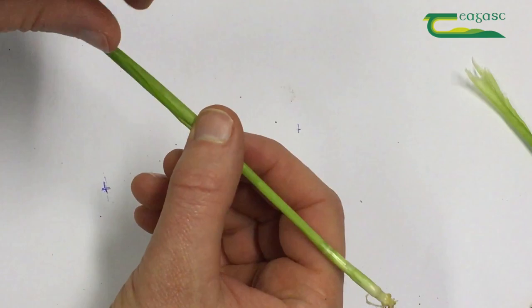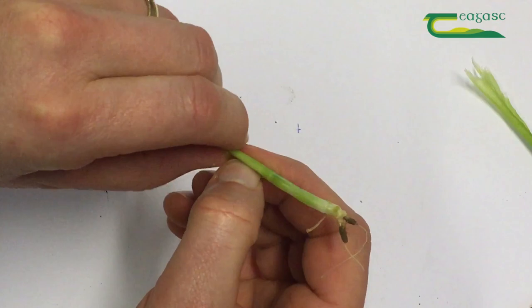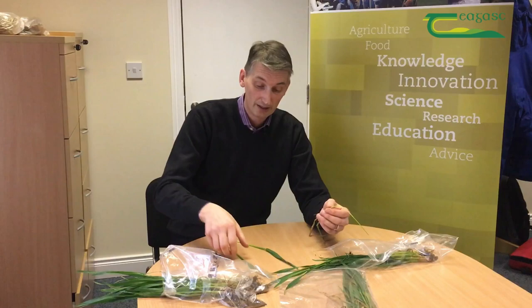There's no need to break any of the leaves. If the leaves are falling apart you need to be a little bit more delicate. The great thing is you can always start with a brand new plant to keep practicing. Rolling it all the way out, you can see the new leaf that wasn't even visible before we started — here it is underneath, all the way down to the new node.